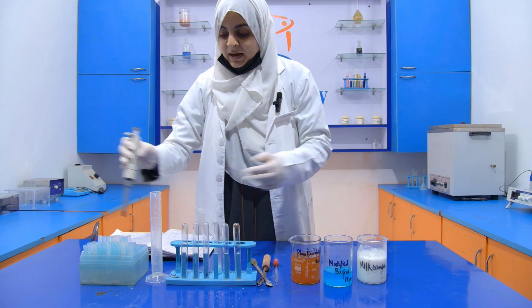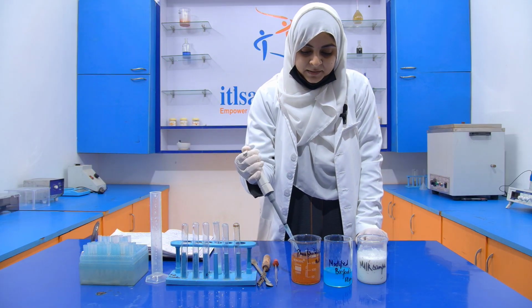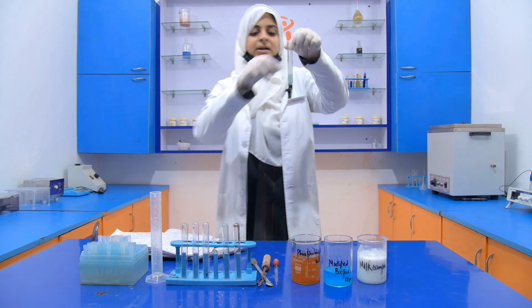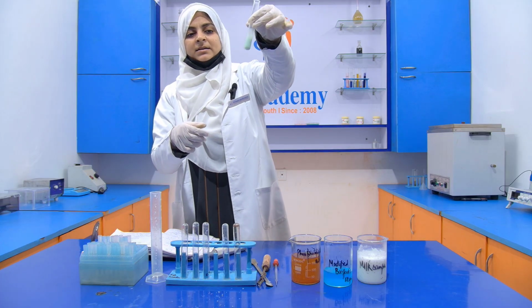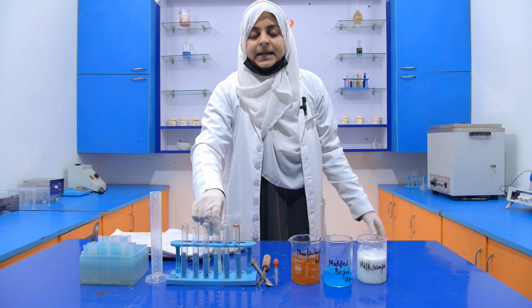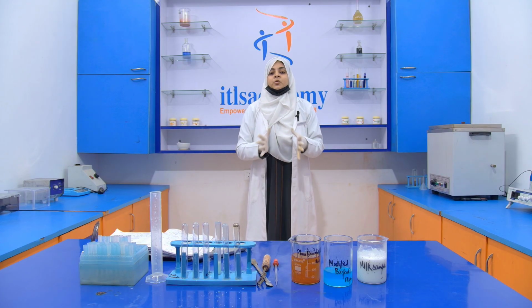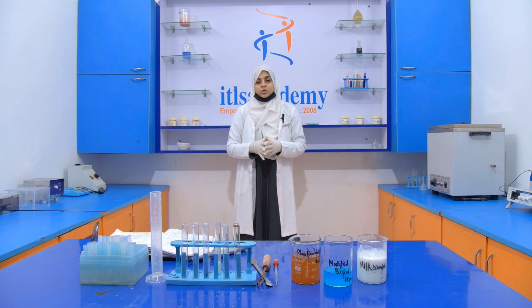Now after cooling it, we have to add 1 ml of this phosphomolybdic acid. If the solution turns a deep blue color, then it indicates the presence of glucose. See that we get only a slight blue color. It is not a deep blue color, which means that our sample does not contain any added glucose. The glucose already present in milk is natural, but here there is no adulteration of glucose. So this is all about the detection of added glucose in milk.